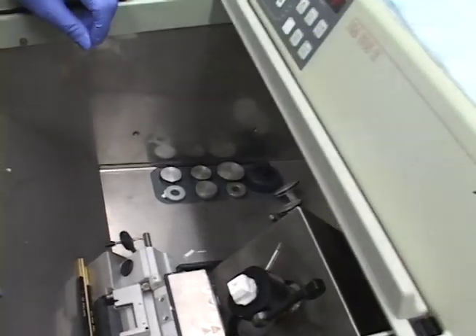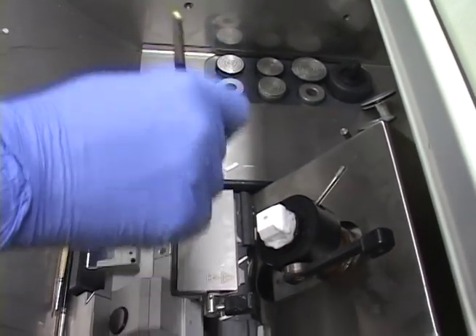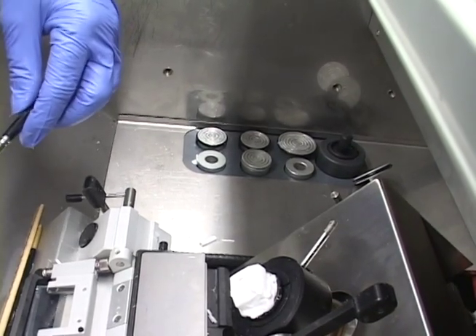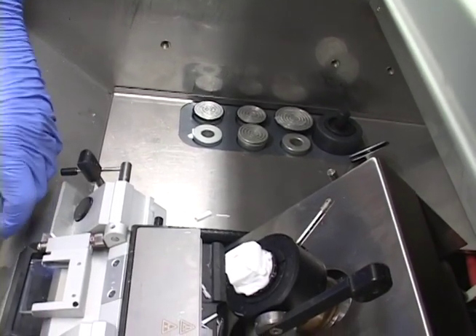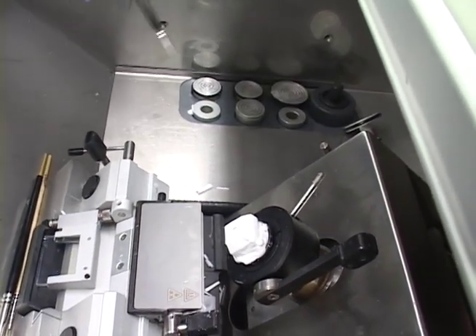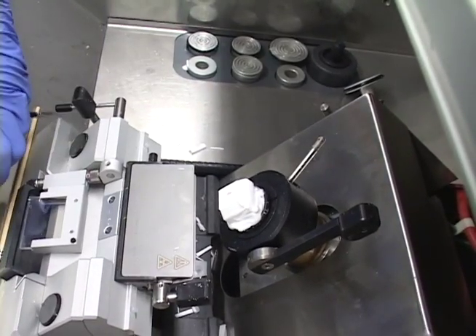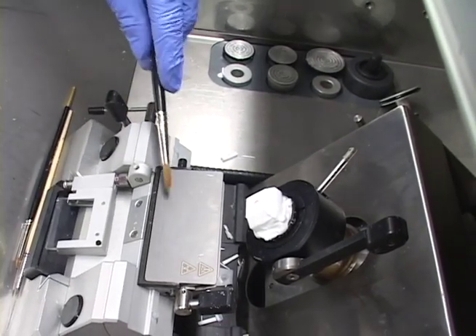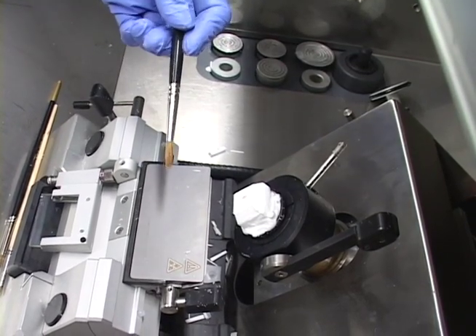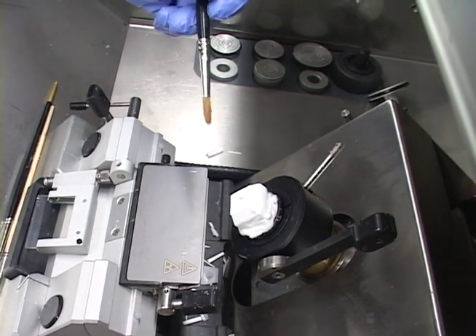Now there's also a brush method. I recommend everybody learn this brush method because if a roll plate is acting up, several cryostats don't have a good functioning roll plate. To be an expert at doing this, you really need to learn how to use the brush method. I use this brush — some people like using a fatter brush. What you want is you don't want it too soft; if you have too soft a brush, cut off some of the ends to give it a little firm grip.